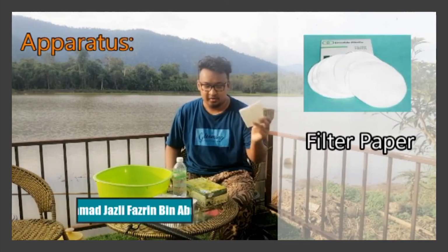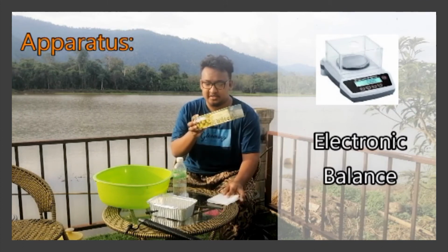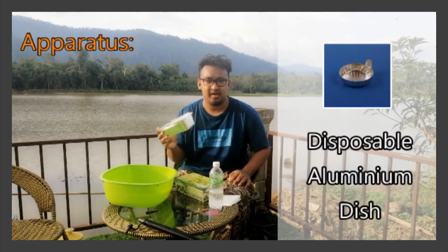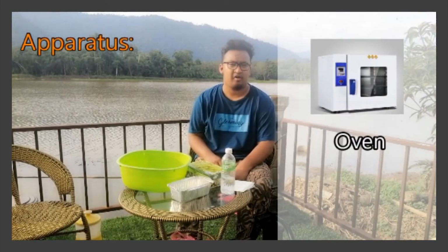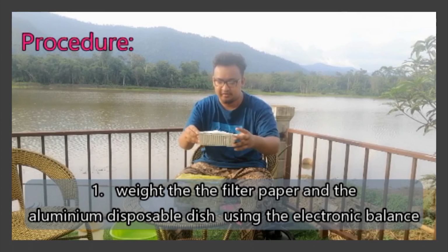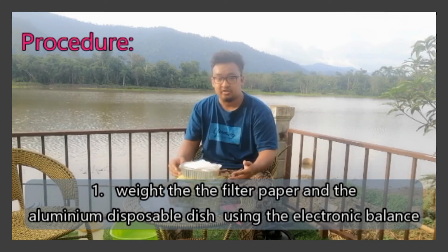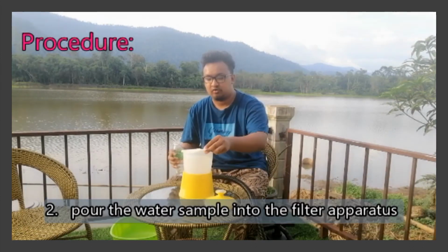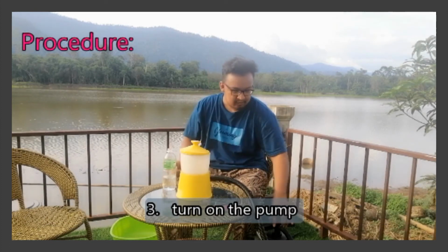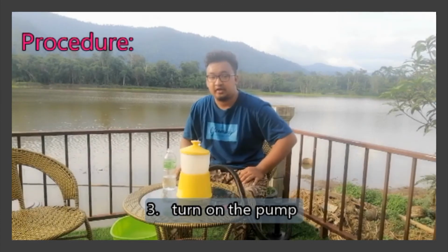So our apparatus is filter paper, electronic balance, water sample, desiccator, disposable aluminium dish, and oven. First, we weigh the filter paper with the disposable aluminium dish using the electronic balance. Next, we pour the water sample on the filter paper and turn on the pump. The pump will suck all the water from the sample.